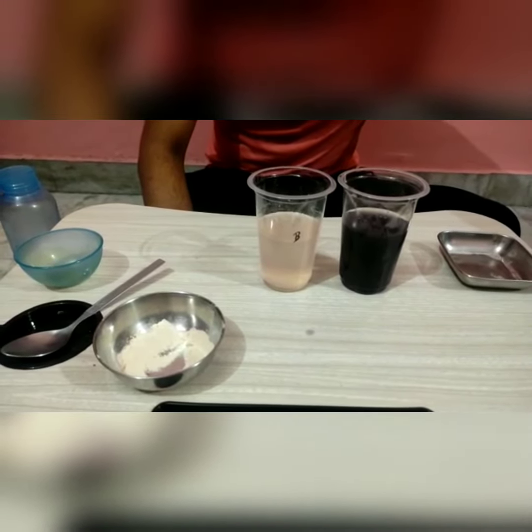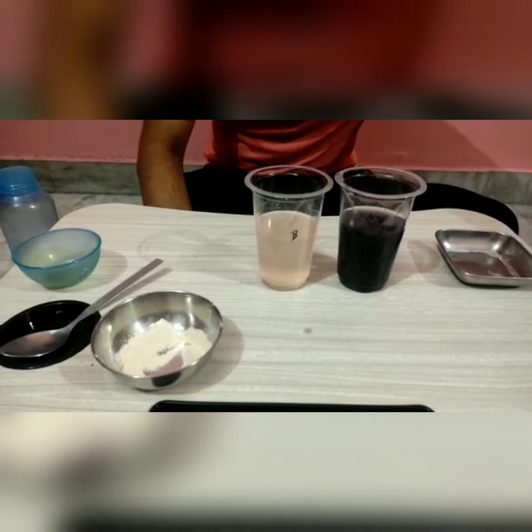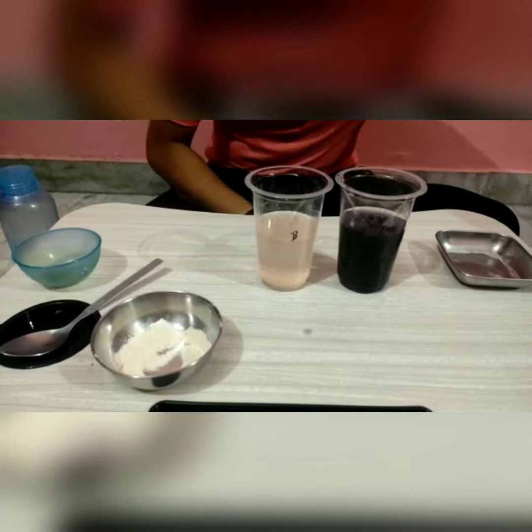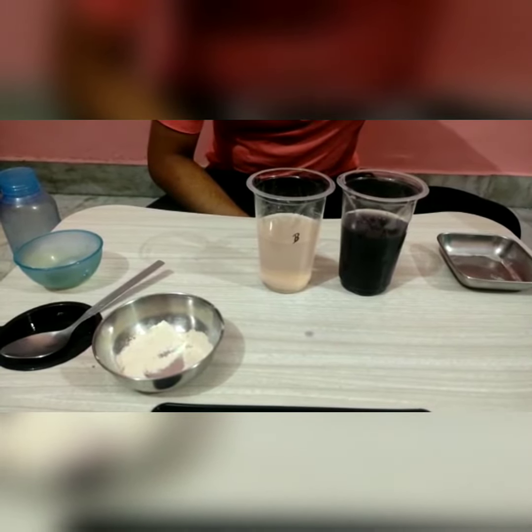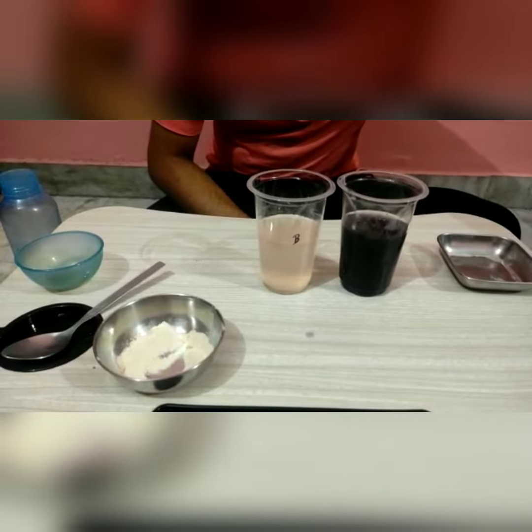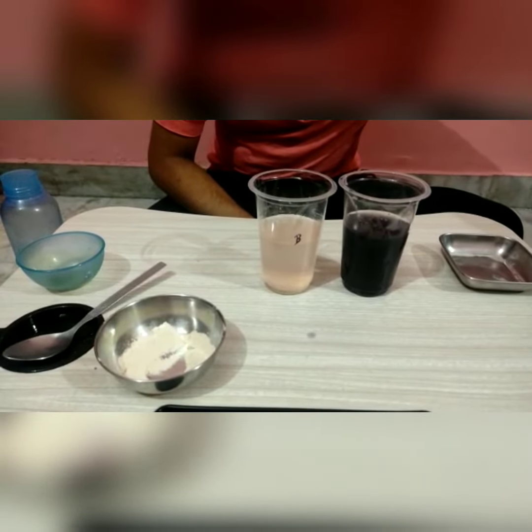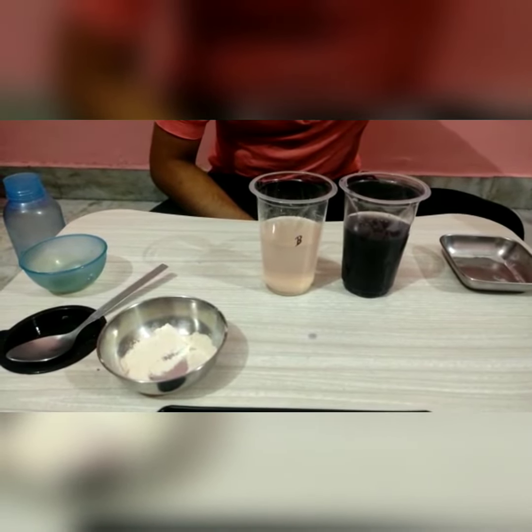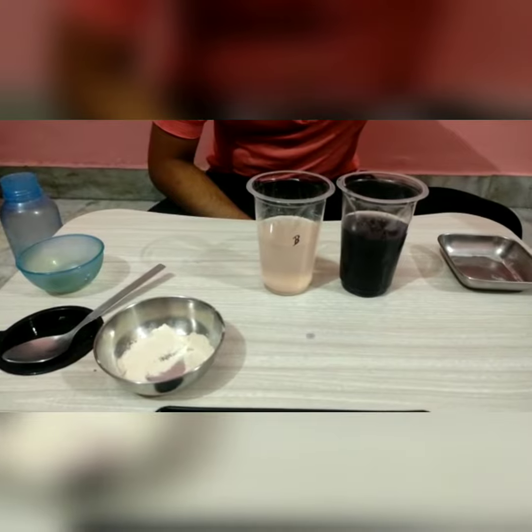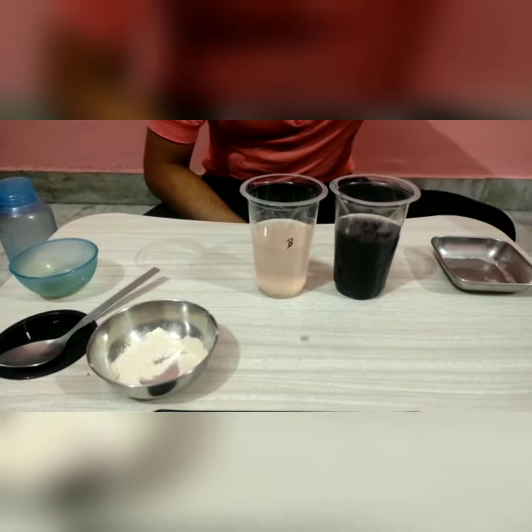Starch provides blue-black color with iodine, whereas maltose doesn't. This is the reason when we add saliva to starch and then add iodine, the color doesn't change into blue-black color. Thank you.